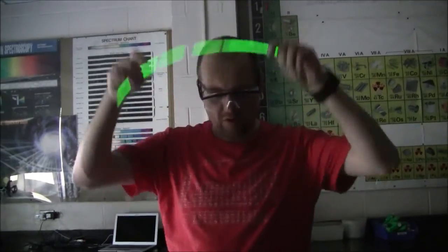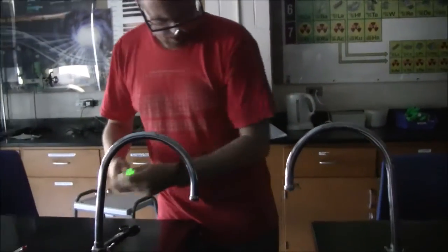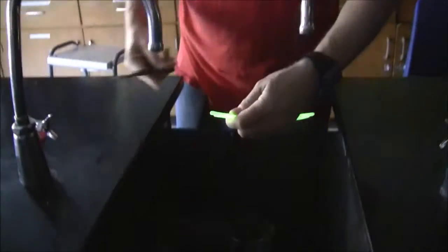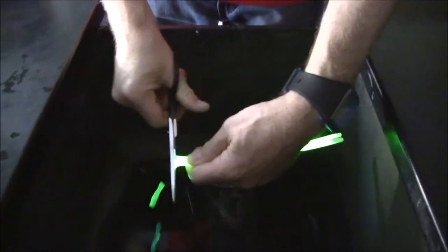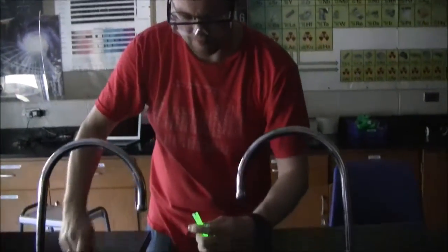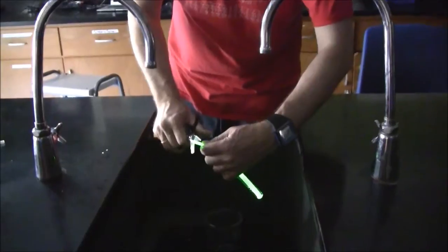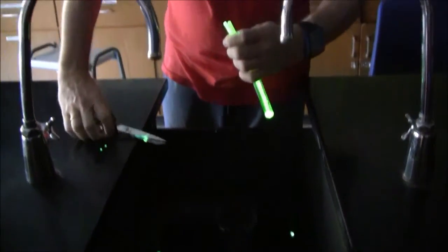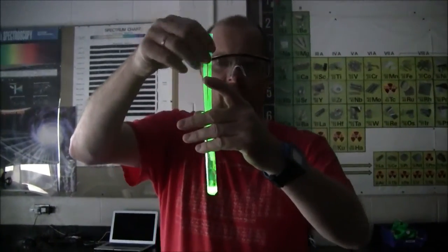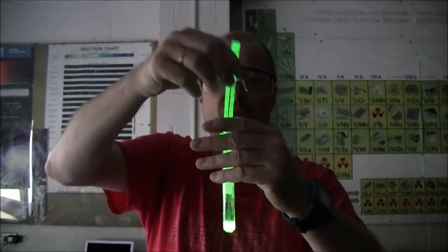So we're waiting 10 minutes for this to finish the primary glow. So after about 10 minutes take your glow sticks and we're going to transfer them into this test tube. Now a classic mistake is to try to do it like that. Obviously they're not going to come out until you remove the top. Now I've got non-toxic glow sticks but they do contain a little bleach and possibly a little broken glass. So you've still got to be a little careful.